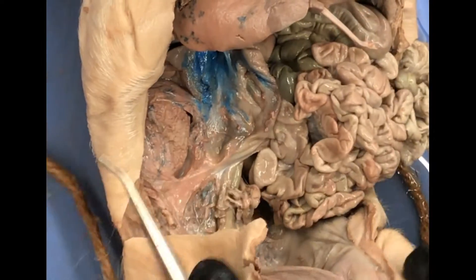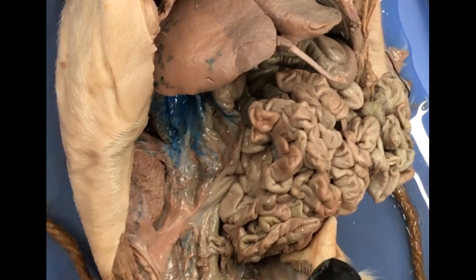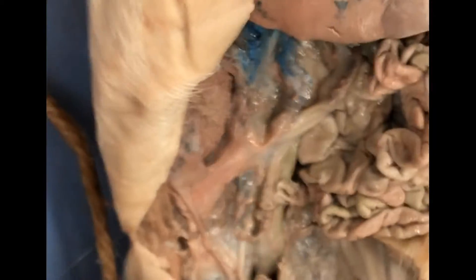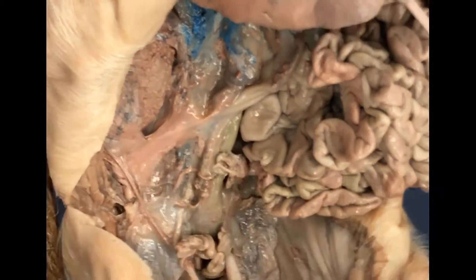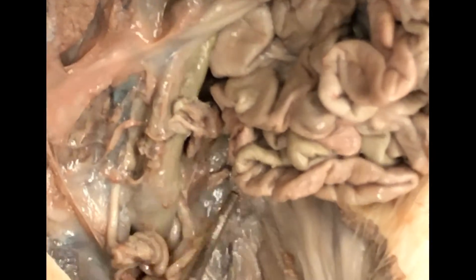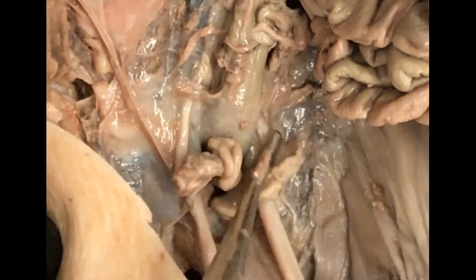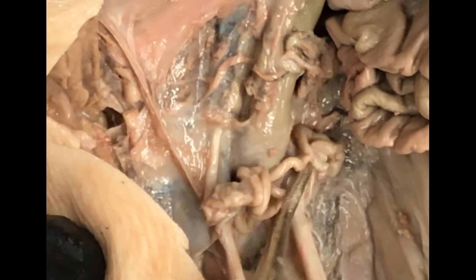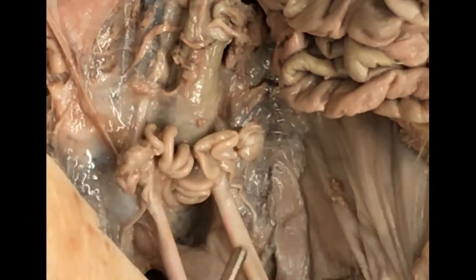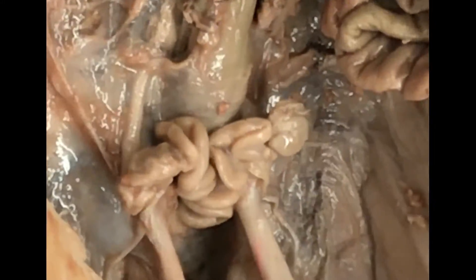This pig is a female. Behind the urinary bladder, if you pull that down, you'll see these squiggly tubes — they look like ramen noodles. Those are uterine tubes, or fallopian tubes, or oviducts — a lot of names for those.